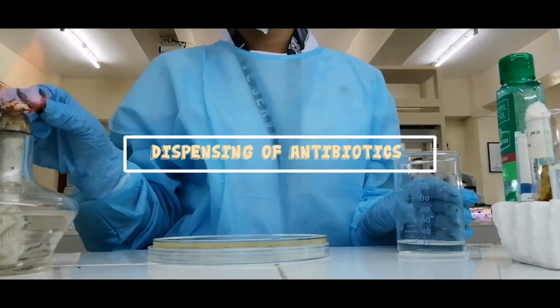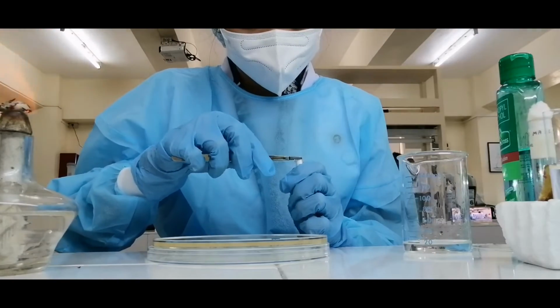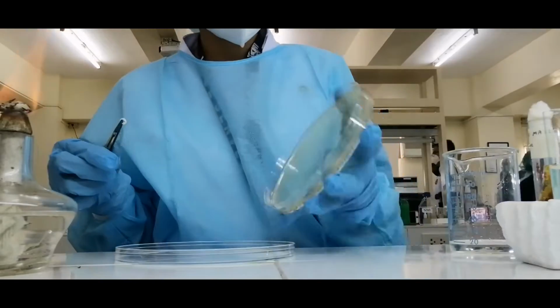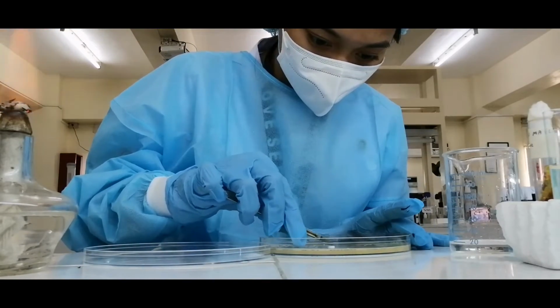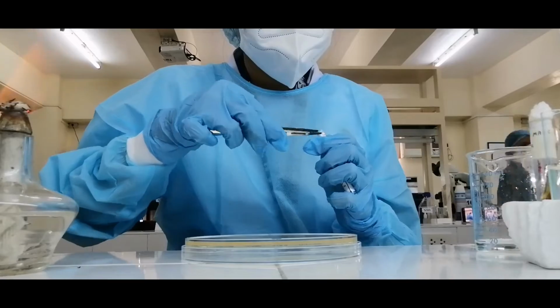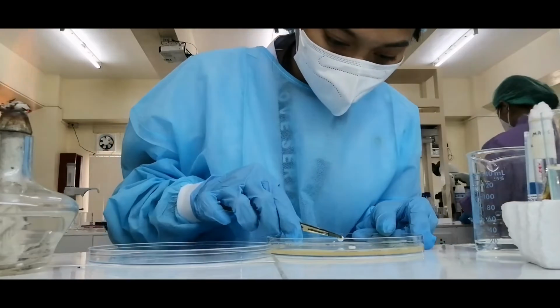Antibiotic discs should be removed from the fridge or freezer before use and allowed to come to room temperature. The disc can be applied using an antibiotic disc dispensing machine if you have one in your laboratory, or use sterile forceps if you do not have a dispenser. When using the forceps, you should take care not to rip or damage the disc when handling it. Ensure that you press the disc down onto the agar so that it is secure and does not fall off.